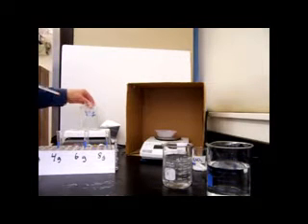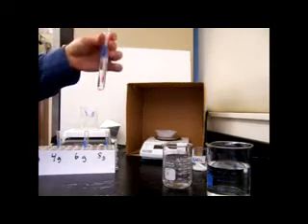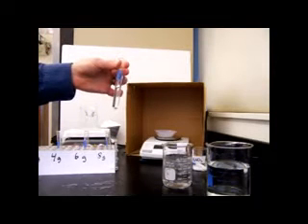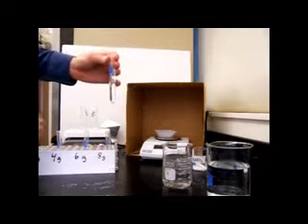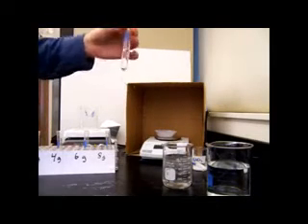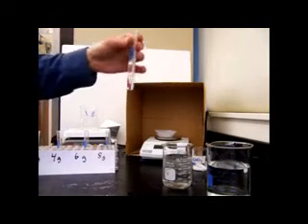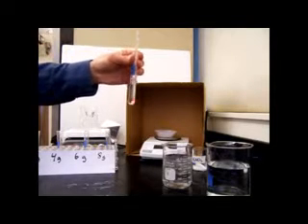And then after we've heated them in a hot water bath for a little while, they'll look like this. So all the particles have dissolved, and you have a solution. In the solution, you cannot see any of the salt particles. Before they're entirely dissolved, you can see the salt crystals. So what we're going to do now is stir this and let it cool and see at what temperature the crystals come back out of solution.